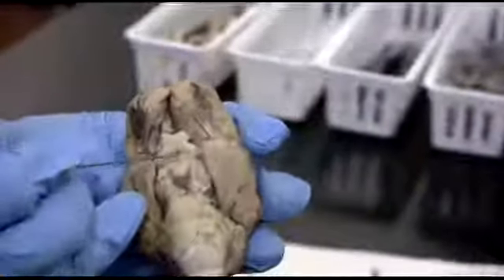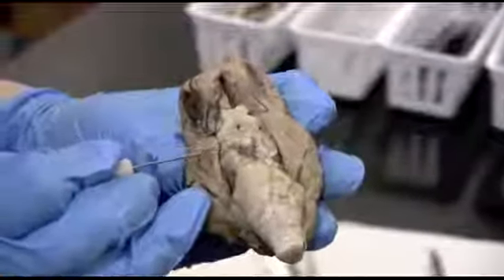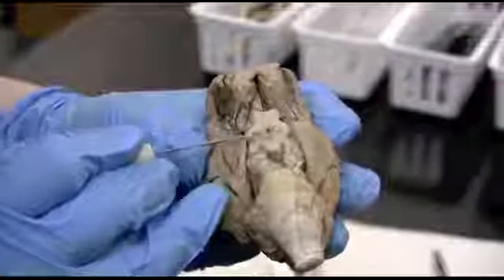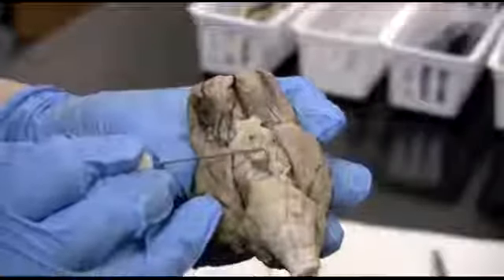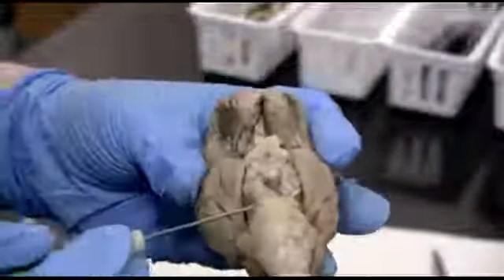Okay, so these right here behind the infundibulum hole, and that just gets cut off when they prepare the brains. These bumps directly behind are going to be the mammillary bodies, and let me see if the other brain has a better view.